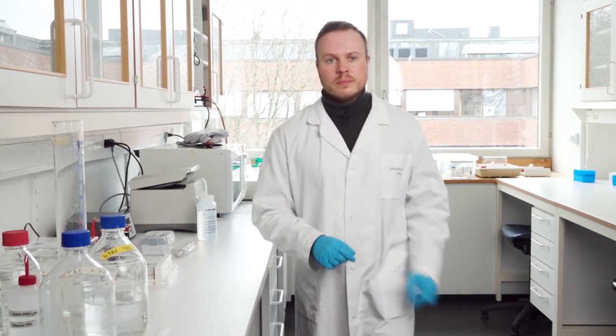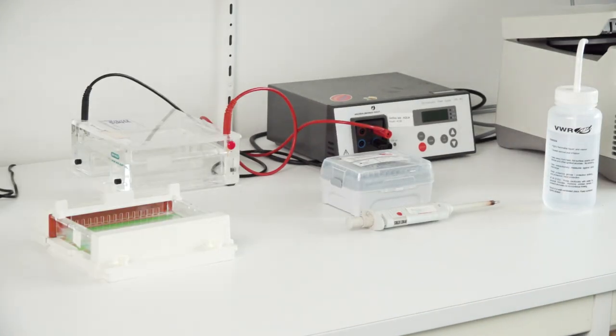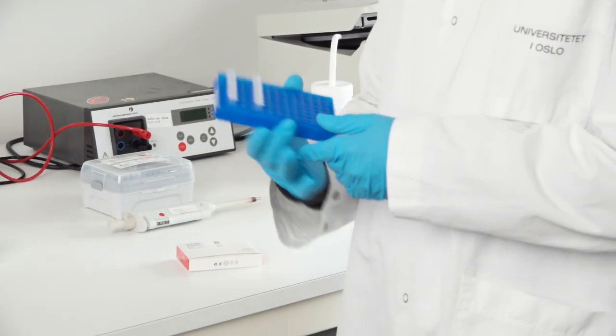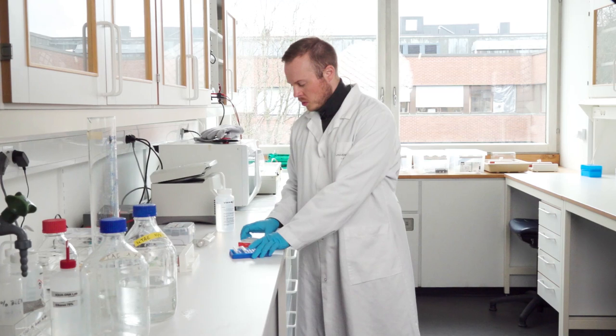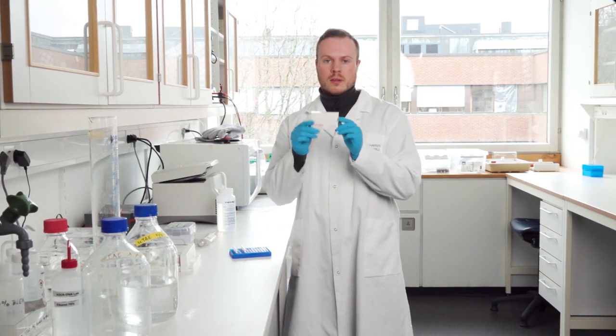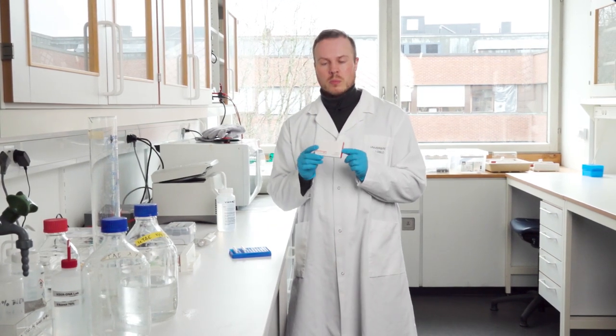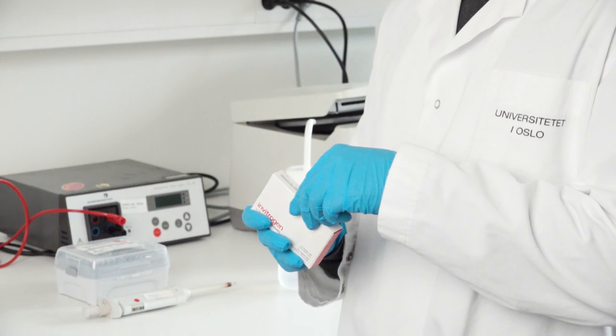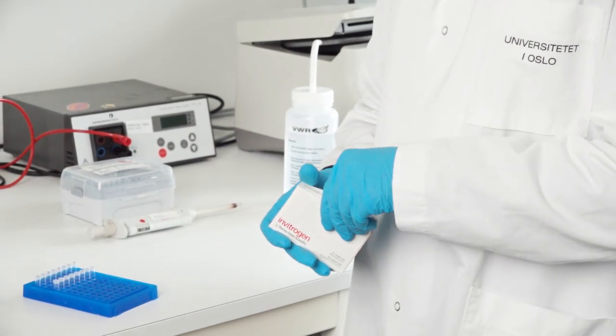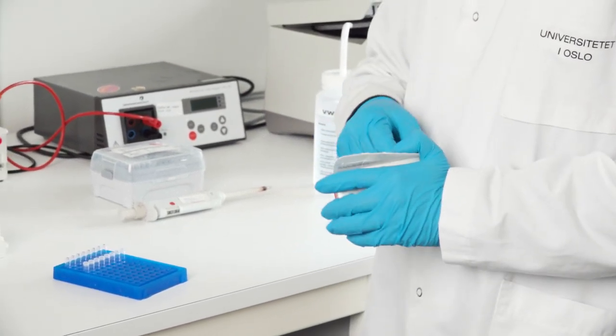So the first thing I need to do is to go and fetch my samples in the PCR machine. So now I have fetched my samples right here. I also got the reactions that we need for loading the gel with our samples and this consists of two compounds.